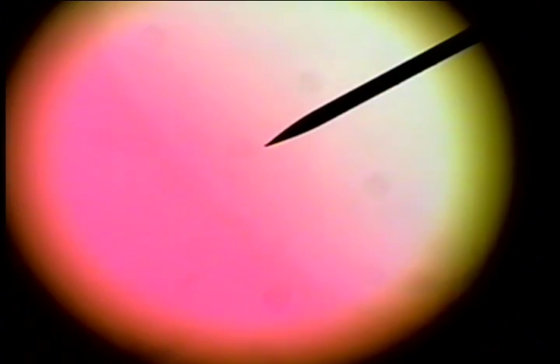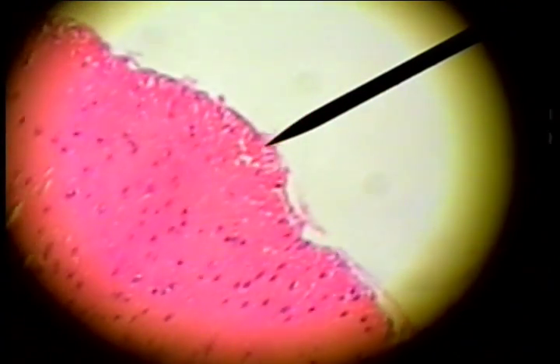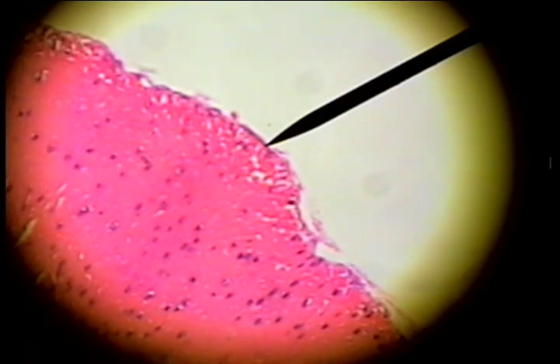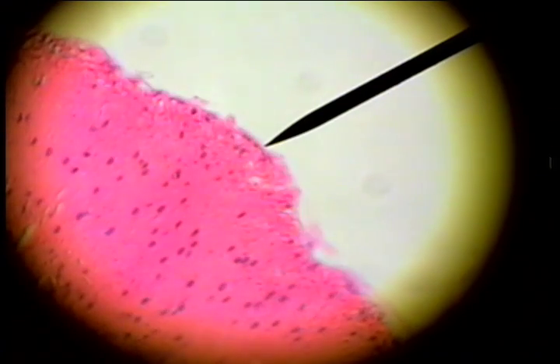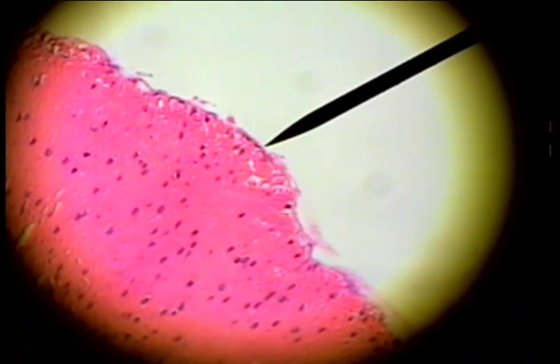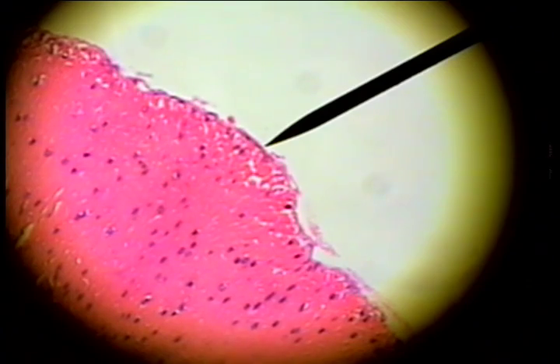If we look at the outer thin serosal layer, we should see a pretty good picture of it here, and here is a good serosal layer. There's the thin, dark line of the serosa.